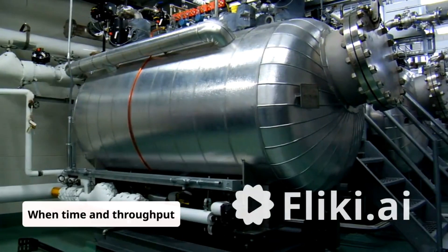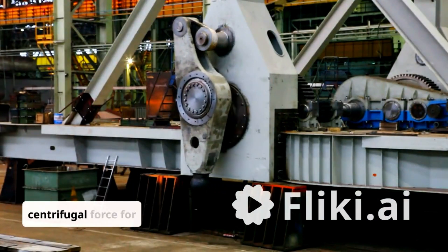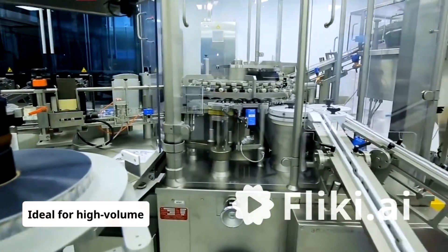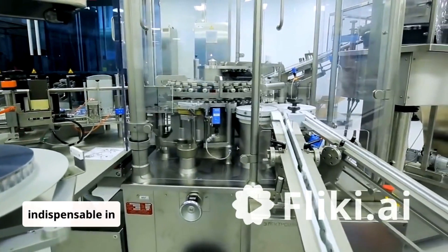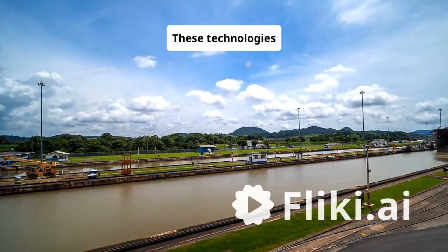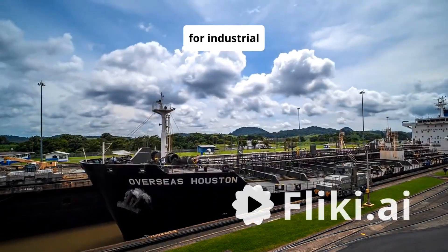When time and throughput matter, centrifugal extractors step up. These machines use centrifugal force for lightning-fast separations and unmatched precision. Ideal for high-volume processes, they are indispensable in industries like pharmaceuticals and fine chemical production. Together, these technologies ensure efficient extraction, high recovery rates, and scalability for industrial needs.